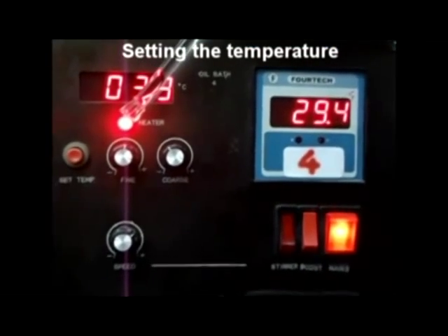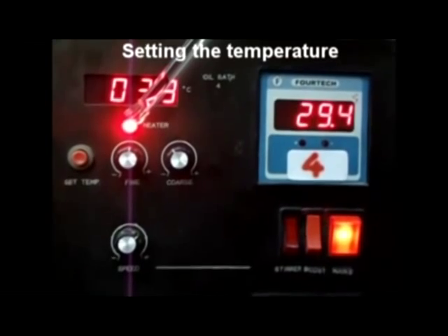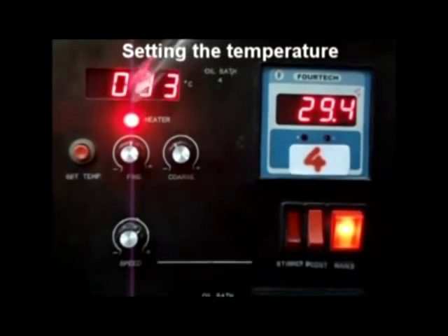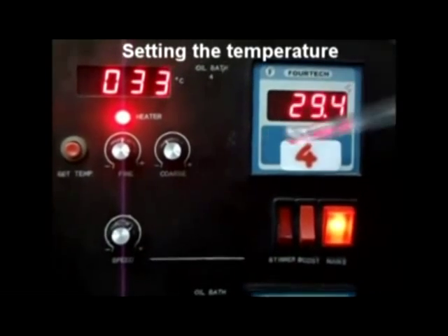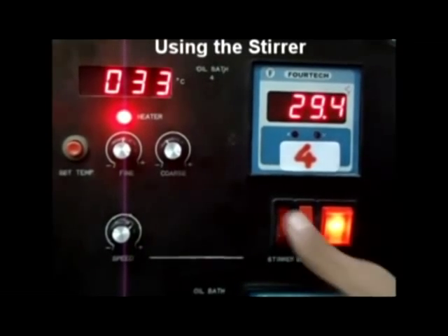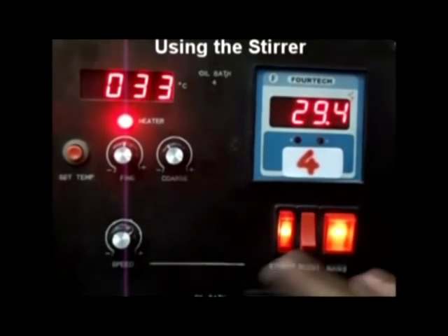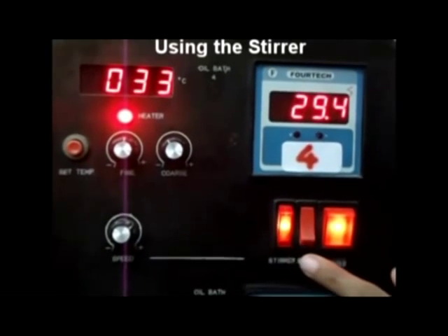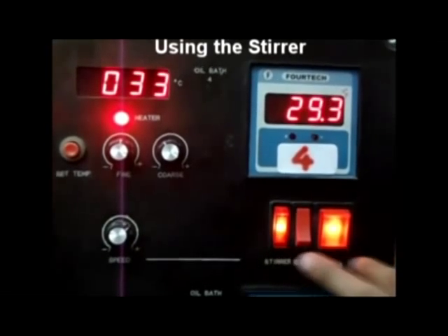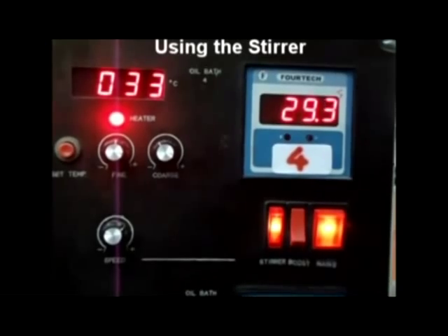The blinking red light indicates that the oil bath is undergoing heating. Now you will learn how to control the stirrer — switch on the button labeled 'stirrer'.